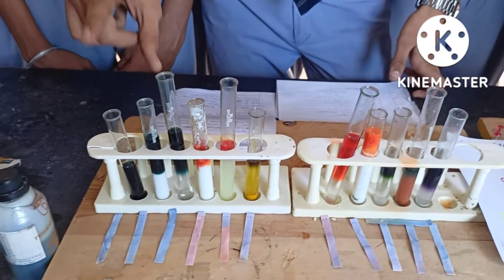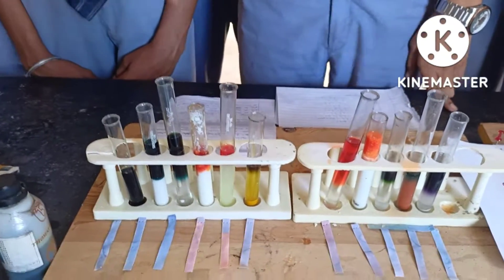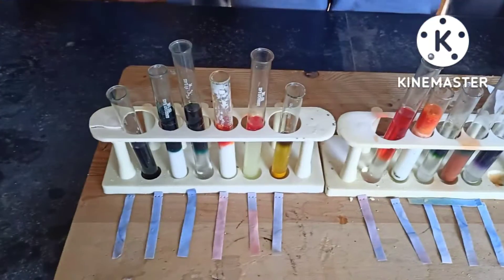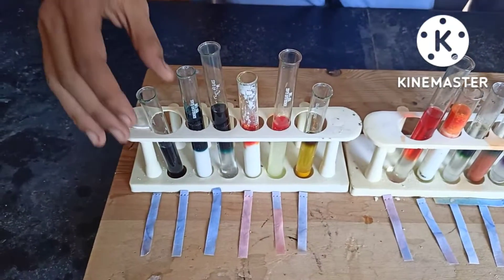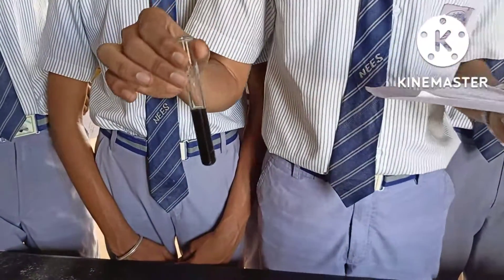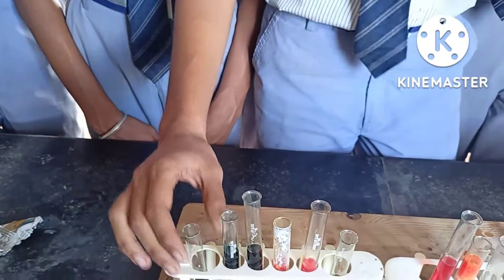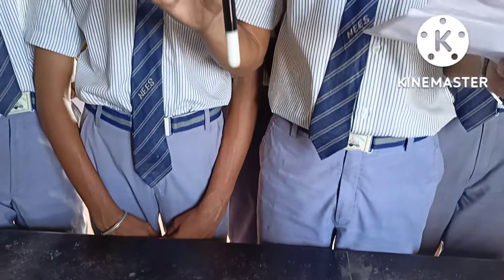The pH of tap water is between 6.5 to 8.5. As we can see, here the color has changed, so based on this color, its pH is found to be 6.5 to 8.5. And for baking soda, its pH is found to be 8.3.